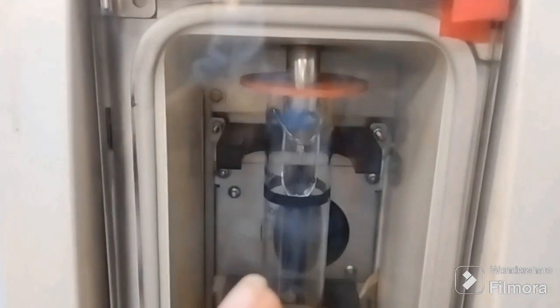Now here, see, on condensation all this vapor is going to be converted back into droplets, right? Drop by drop, as the vapor is condensed, the sample is going to be collected in this cylindrical flask that you can see. And here we have that measurement, that is 100, right? It means this whole cylindrical flask has a capacity of 100 ml.